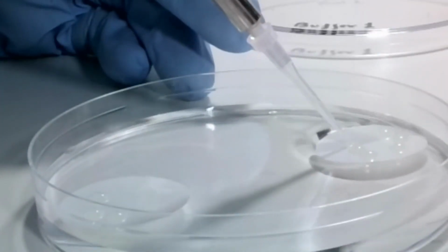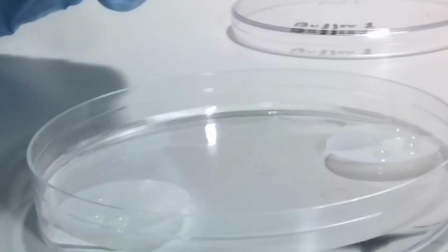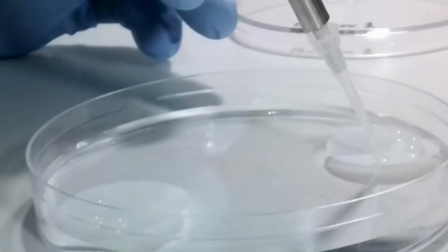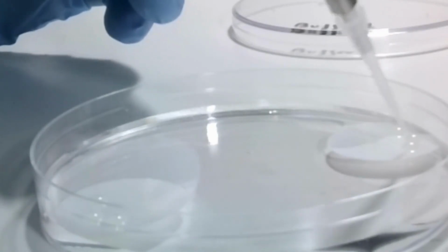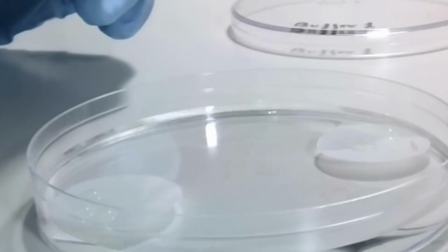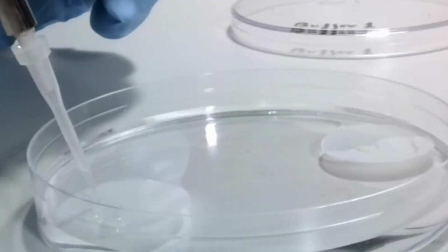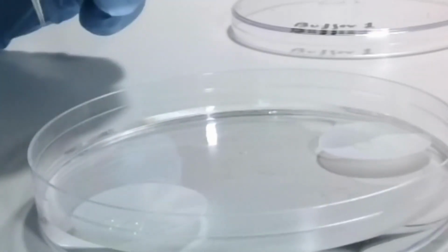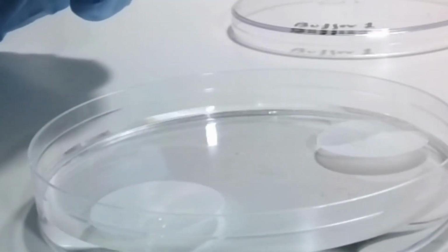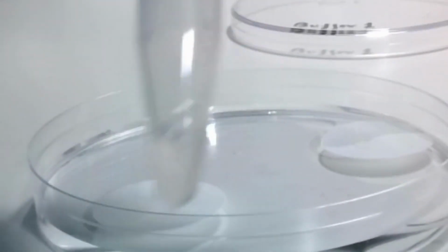After that time, you take the different drops from the filters, and be careful to avoid the interaction between the buffer and the protein drops, because then you will have dilution of the sample and you are not going to be able to analyze the efficiency of the process in the individual dish plates. Okay, so once you have all the contents in a single Eppendorf tube, you can then analyze the result.